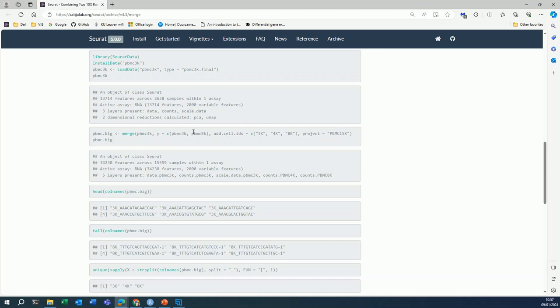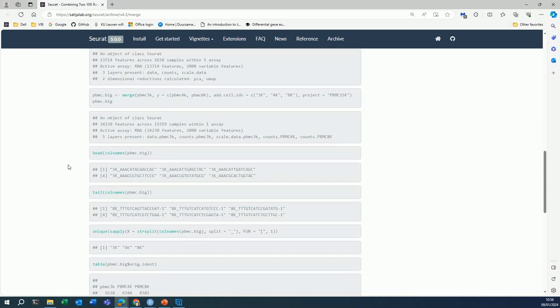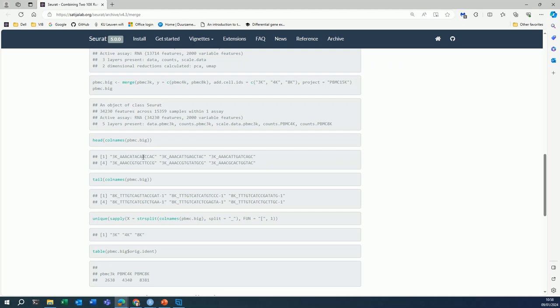It is going to put all the cells from these three Seurat objects in one big Seurat object, but that means that you need to have a way to recognize which cells come from which sample, and that's what these cell IDs do here. You see that when you look at the cells after the merge, the barcodes will be preceded by the ID that you write here. So all the cells from the first Seurat object will have a barcode that is preceded with the word 3K. And all the cells from the last Seurat object will have a barcode that is preceded by the word 8K. And this is how you can recognize which cell comes from which sample.